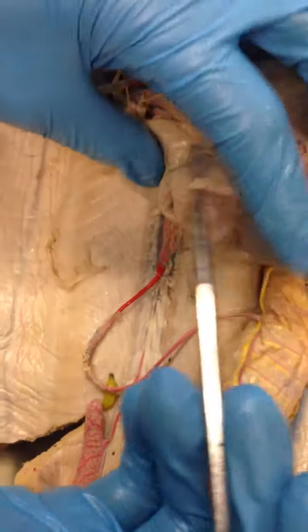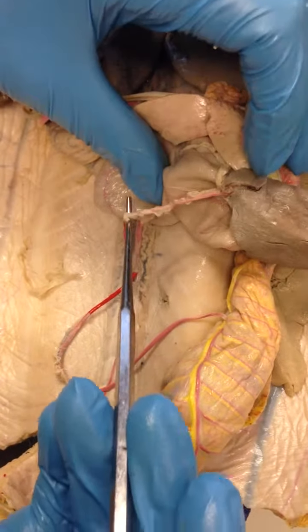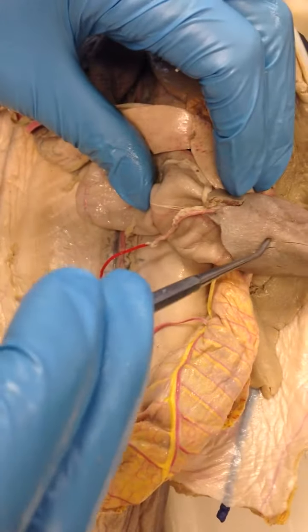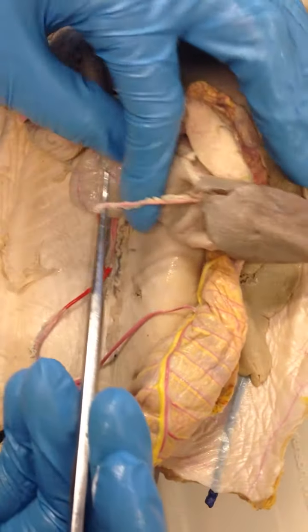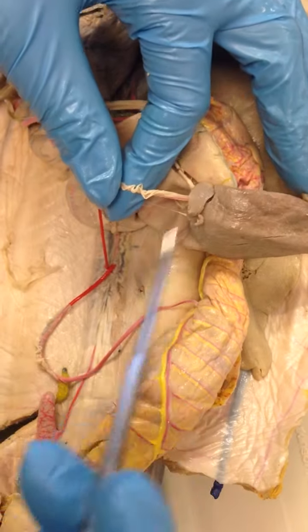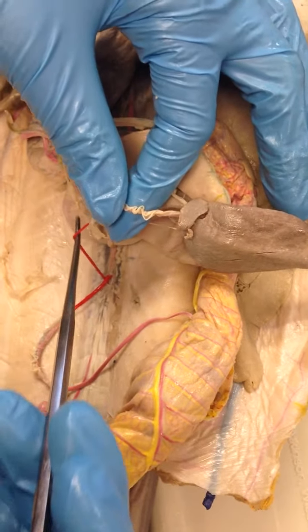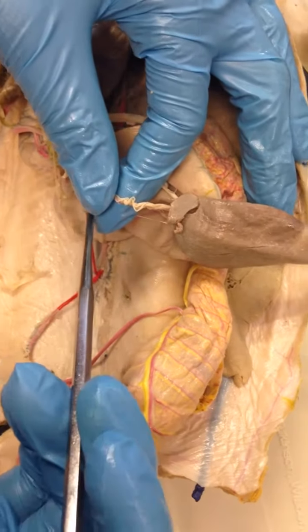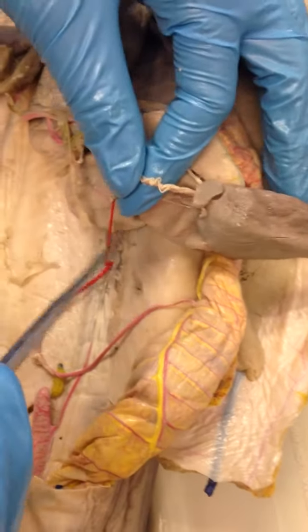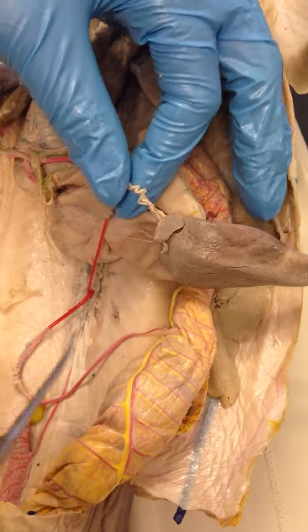This one here, interestingly enough, is sort of similar, but this artery leads to the spleen. Okay, so if you see its journey, it starts from here, goes all the way into the spleen. So therefore, this one here would be called the gastrosplenic artery. So it's located here, leads towards the spleen, therefore gastrosplenic artery.